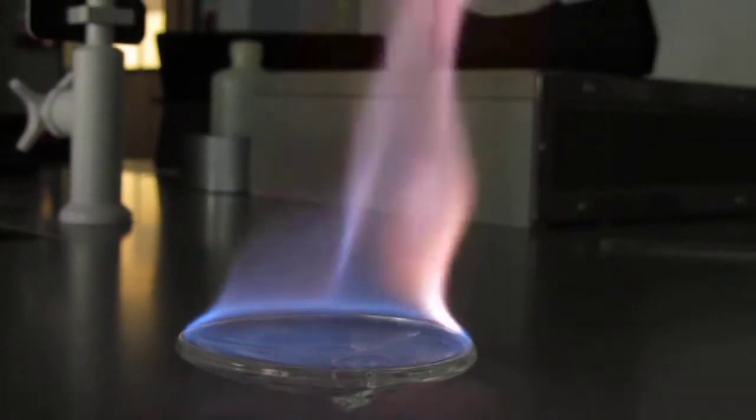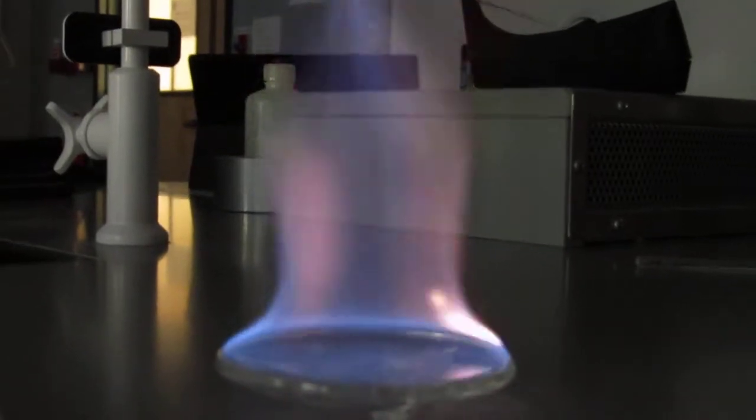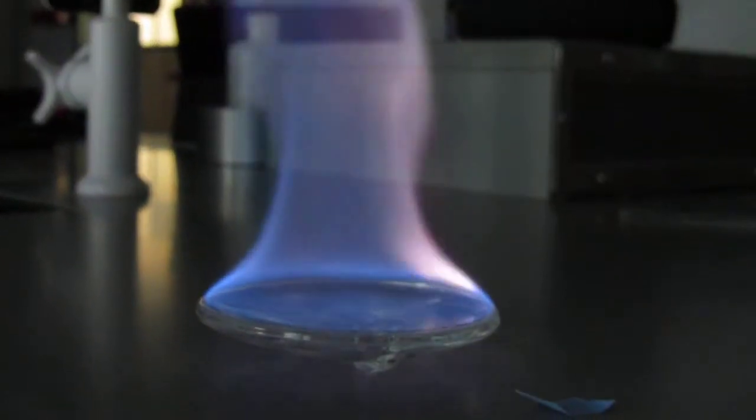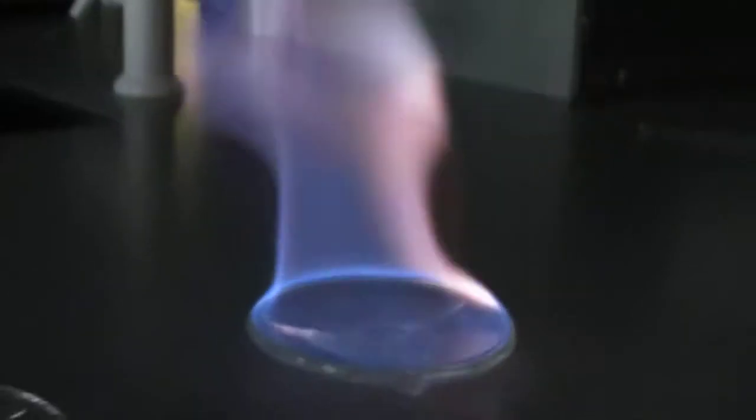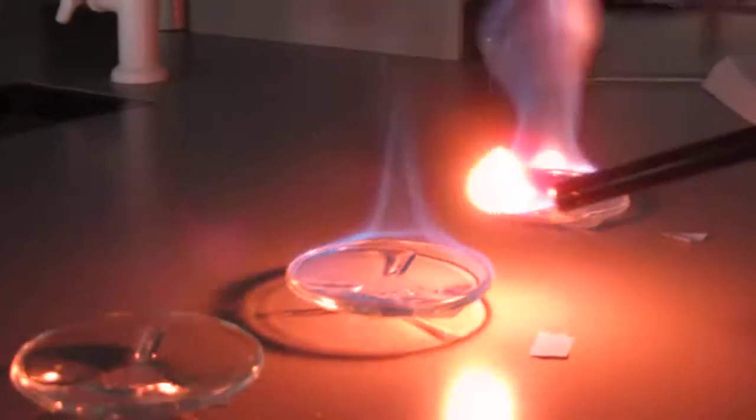They're all going to start blue and then you're going to get to Harry Potter challenge. Yeah, it seems like something they would do at Hogwarts, they would call it magic. Well, this is actually how alchemy started too.